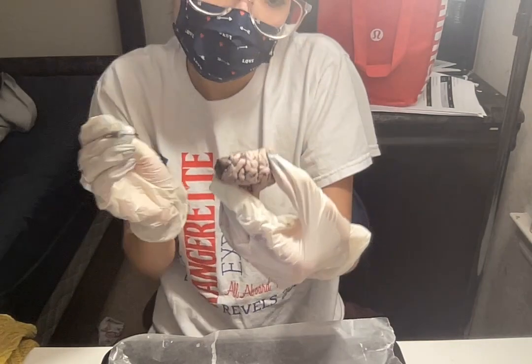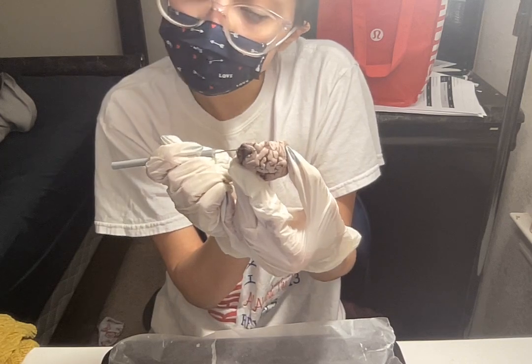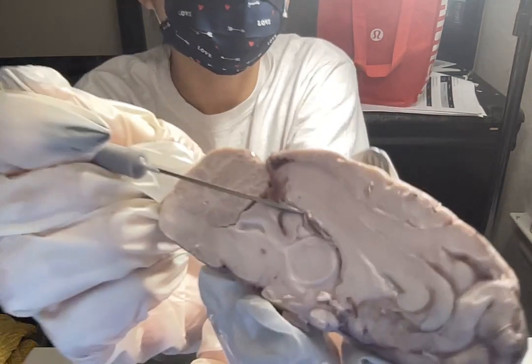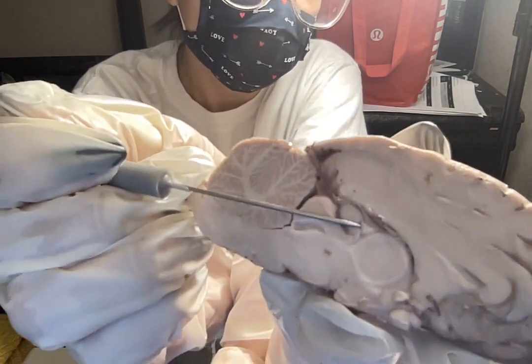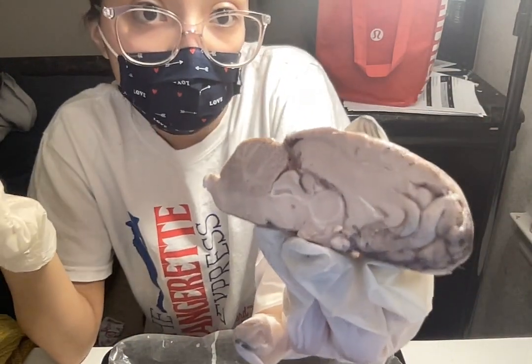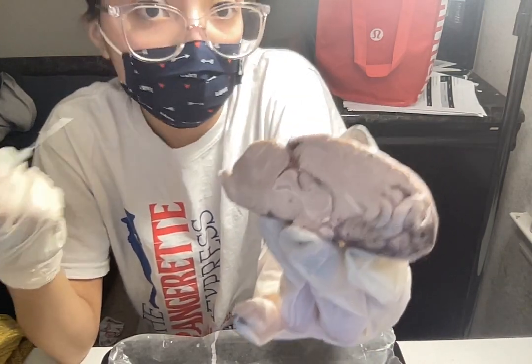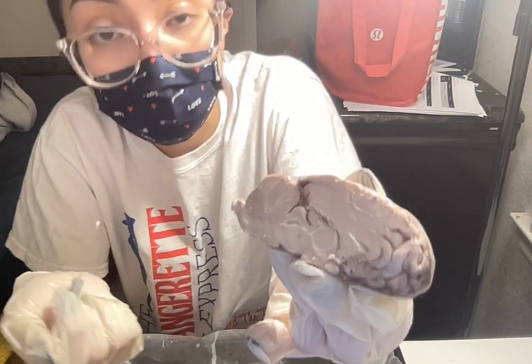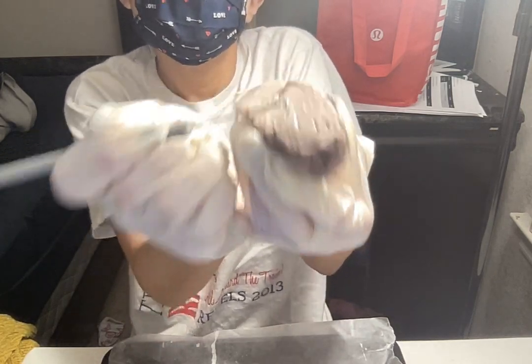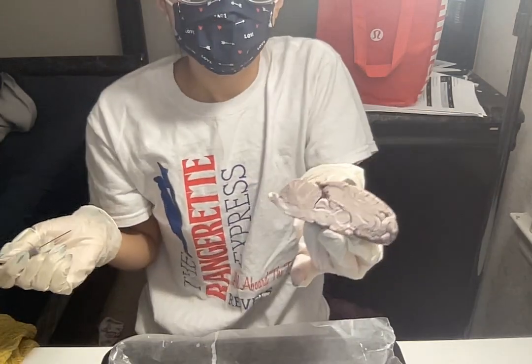And then the pineal gland is very tiny, but it's above the thalamus. It's very tiny. So the pineal gland here, it's kind of pea-sized right here. So the pineal gland produces and releases melatonin. So that's the thing that helps us sleep. It also regulates our circadian rhythm, again, our sleep-wake cycle. So this right here, again, is the pineal gland.